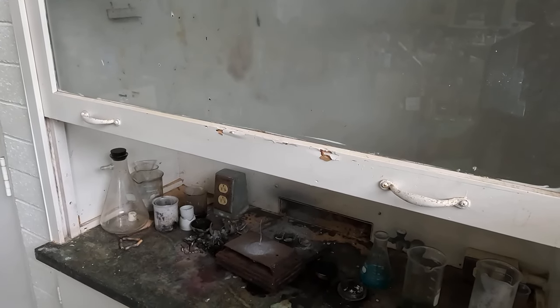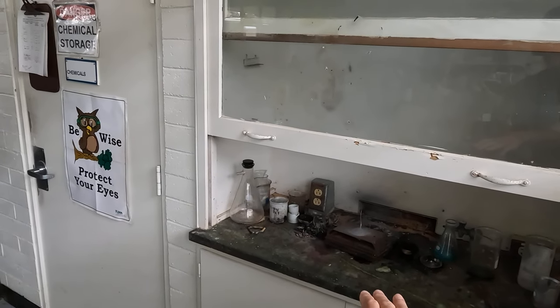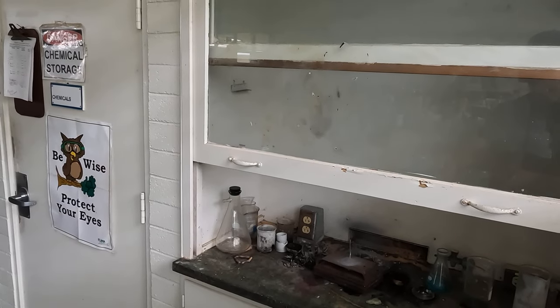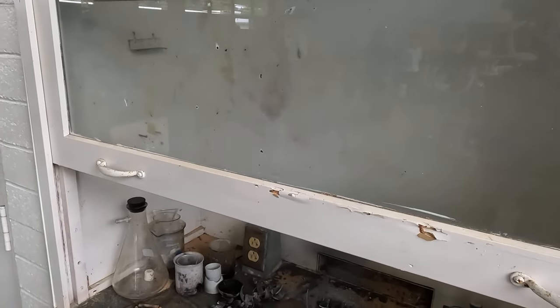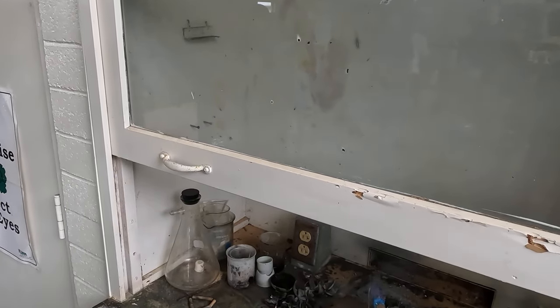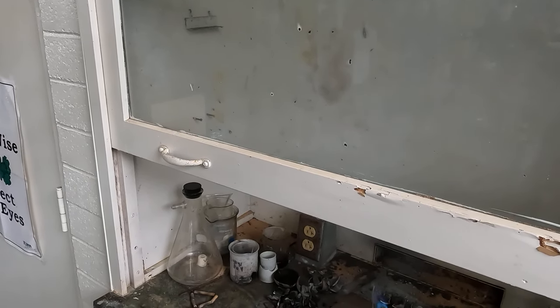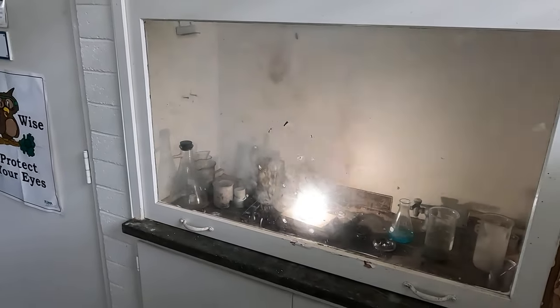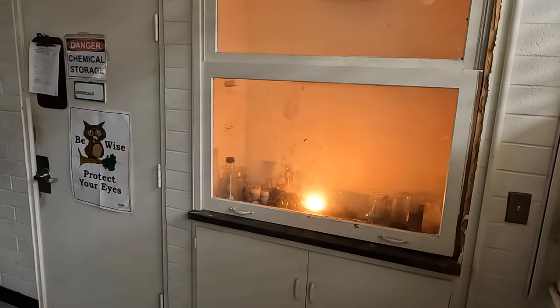I'm going to see if I can turn this on. I have a stack of ring stand-like base plates — they're kind of old. I have to turn my torch on. I'm going to see if I can get the magnesium ribbon to light immediately — going, going, going, and there we go. I'm going to stand back for this one.